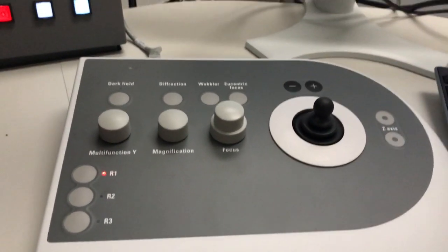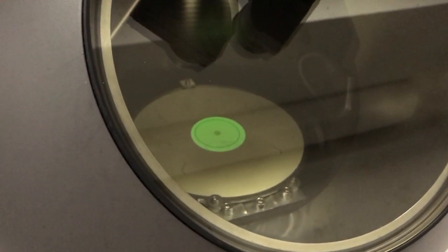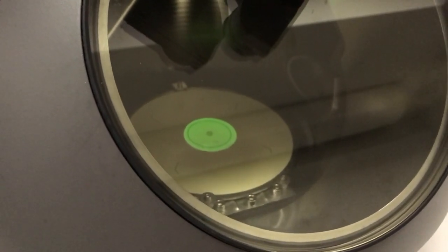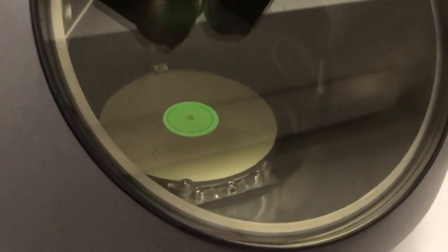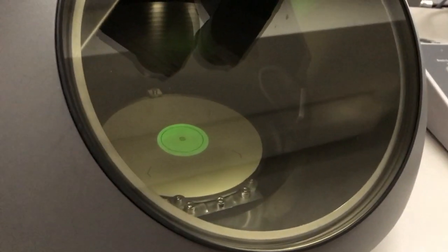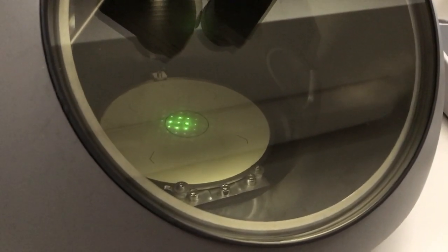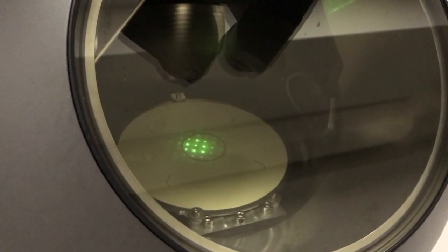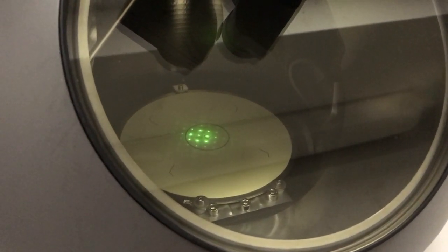is go back into image mode. You can actually see, it's probably a little hard to see, but I'm right at the edge of the sample. So I have a lot of open space in there that's contributing to the DP, which explains why I lost a lot of that signal. So I'm just going to move the stage back right here. Now I'm basically over everything, over sample. I go back into diffraction, and so you can see now I have my diffraction pattern aligned with the zone, or the specimen aligned with the zone axis.